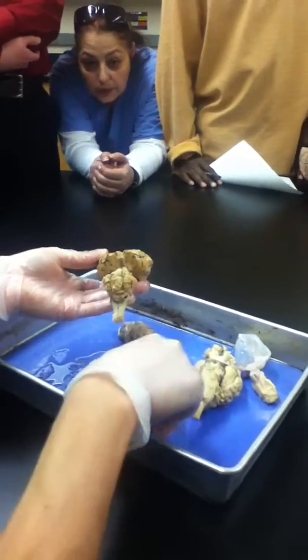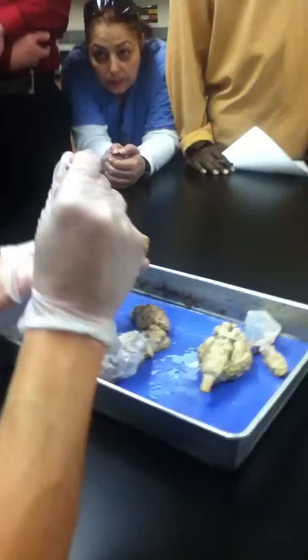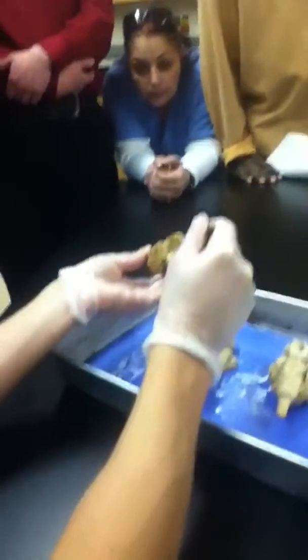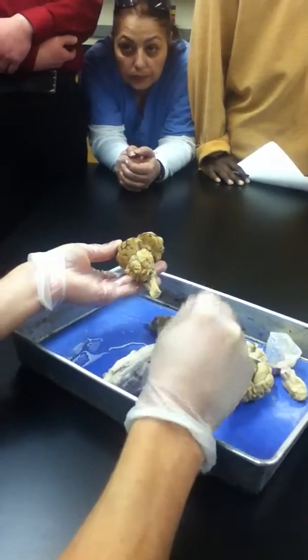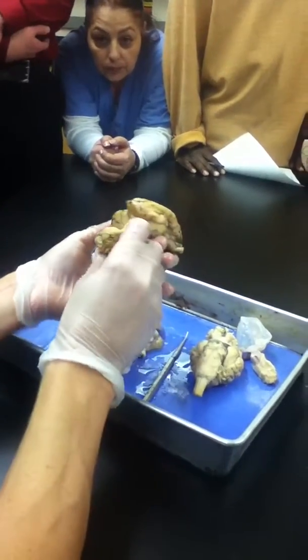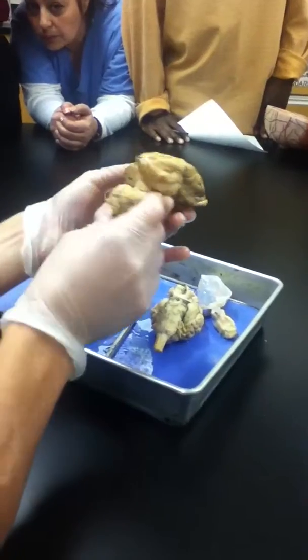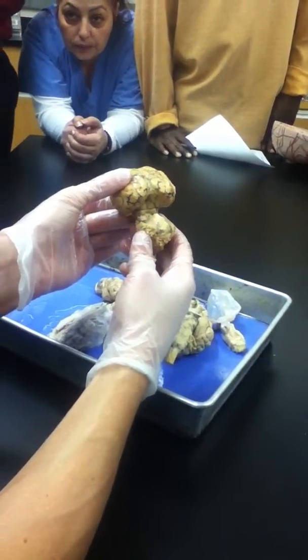So of course, if I stuck a pin into any of those four bumps, you would name them individually. But what if I put a pin right in the middle of the four and just said name the brain region? What is the whole thing part of? Midbrain. The midbrain, good, exactly. So those four bumps you see are the pairs of superior and inferior colliculi when you open up the transverse fissure, but the whole brain region that you could name potentially for the whole thing is midbrain.